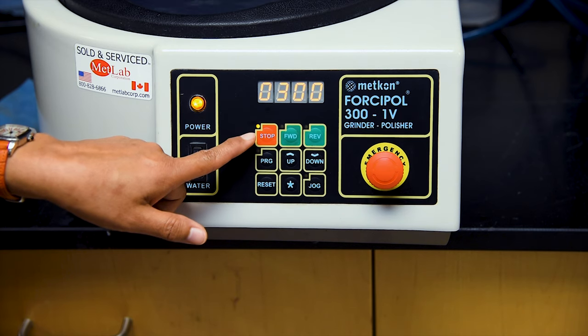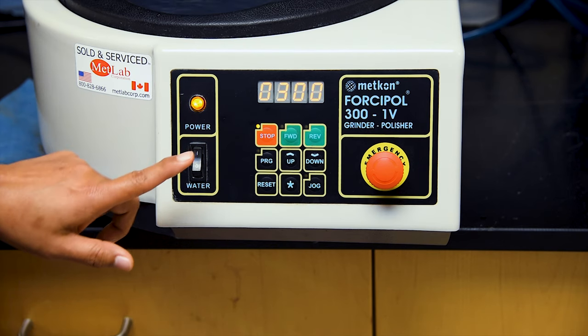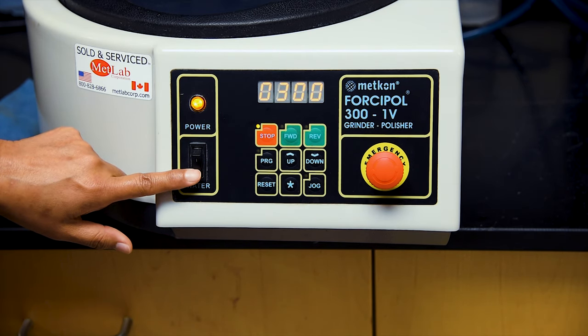Otherwise, the wheel in the machine may be shut down normally using the control panel, and if we're finished, we will turn off our water source and power off the equipment.